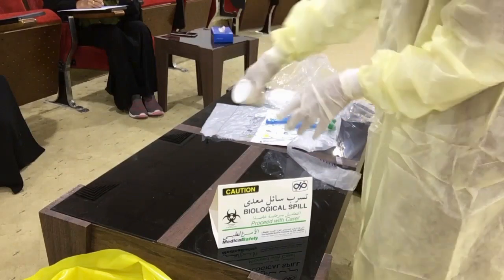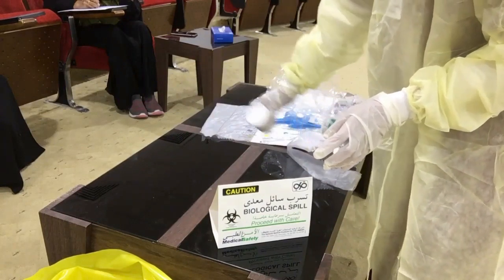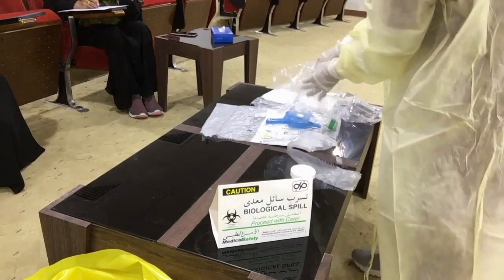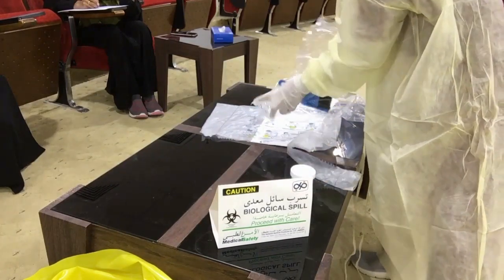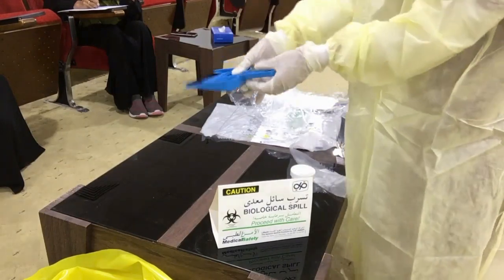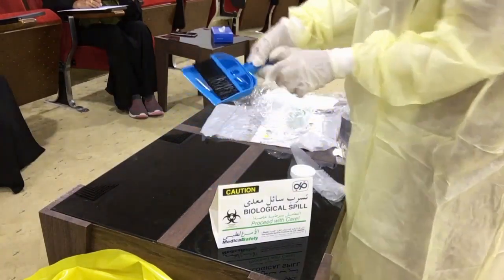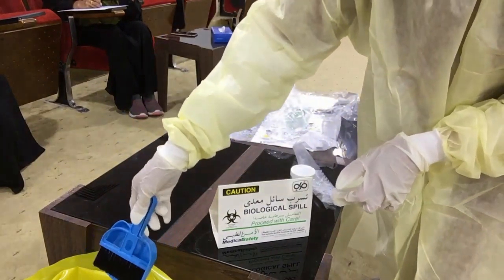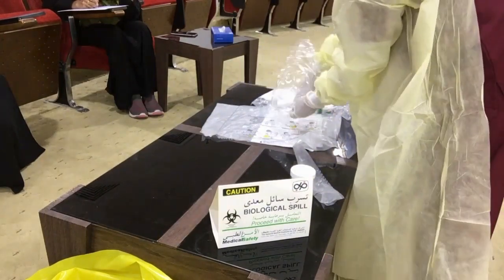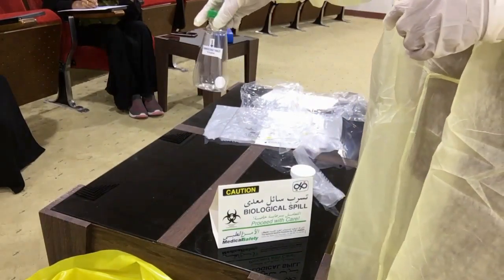Pour the absorbent powder on the area. It will take 2 minutes — you have to wait for 2 minutes for it to absorb. After that, use the scraper to remove the absorbed material. Then prepare the chlorine disinfectant tablet — this is the Clorox tablet.